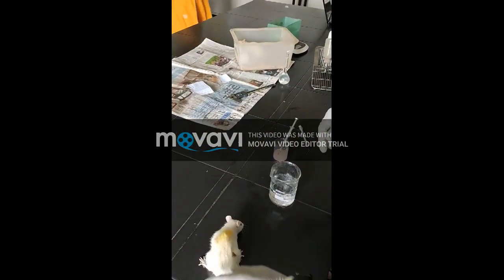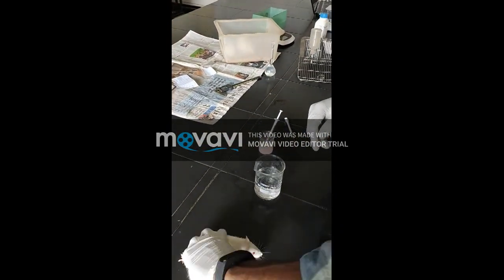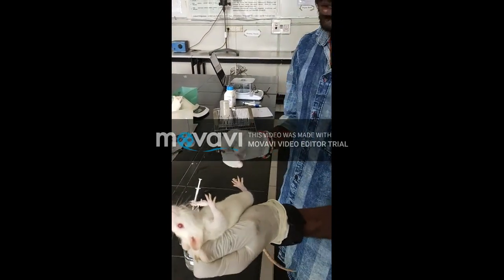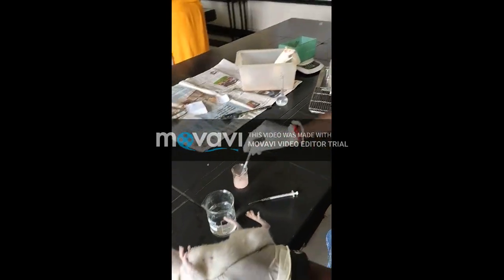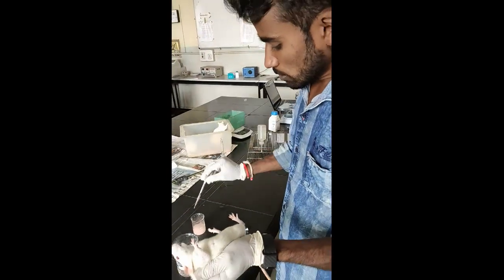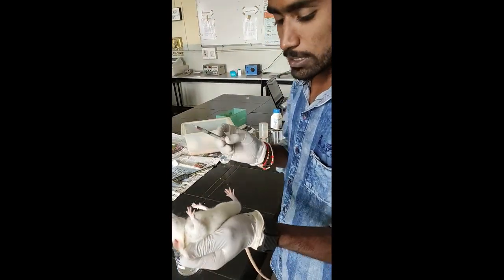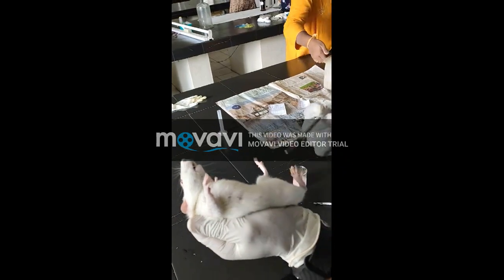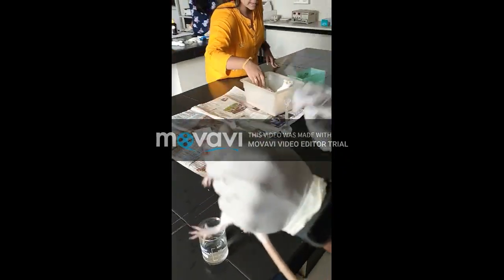Now I am giving aceclofenac 10 mg per kg body weight by IP route. I am taking 0.29 ml for body weight as calculated. Administering via IP route, then leaving it for 1 hour.